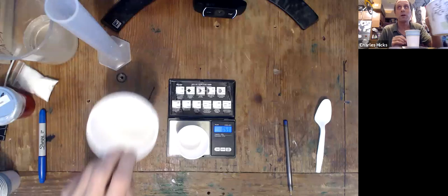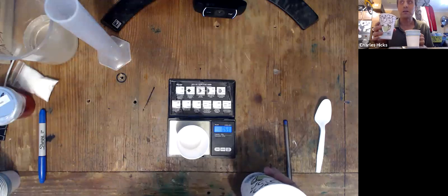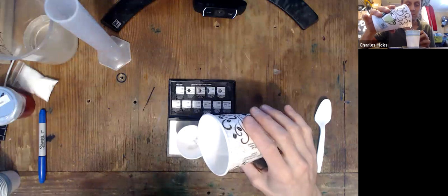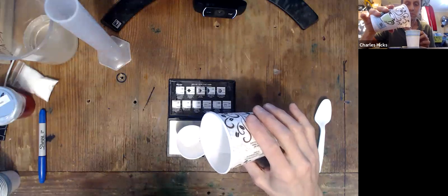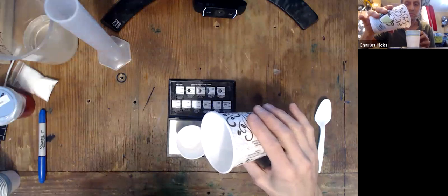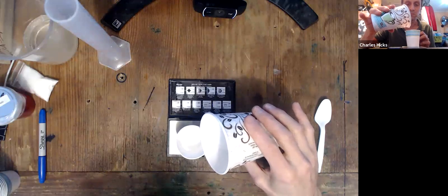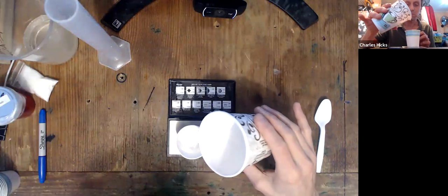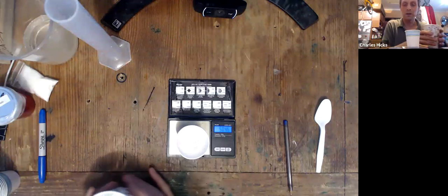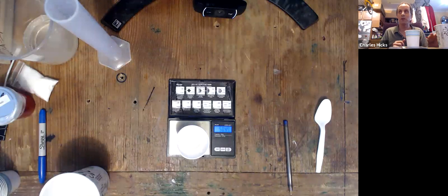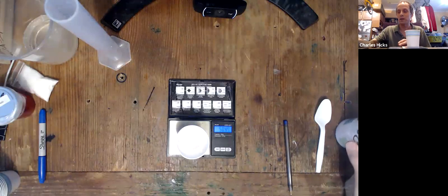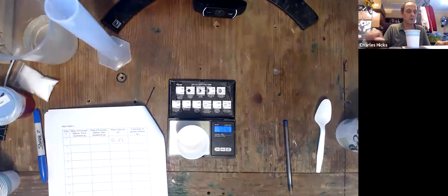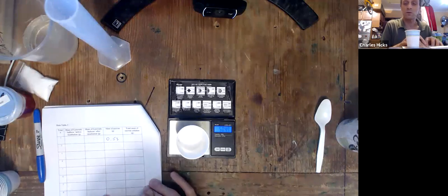Now next, I want to add water to that cup without zeroing it until the total mass is about 50 grams. 50.46 is perfectly acceptable. Anywhere from 49 to 51 would be okay. So I'm going to record that in my data table also. That's the total mass of the solution for this trial.